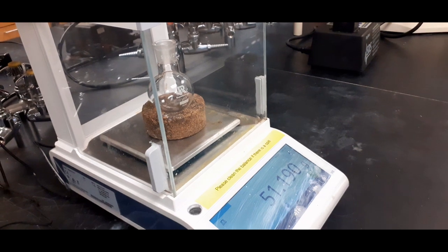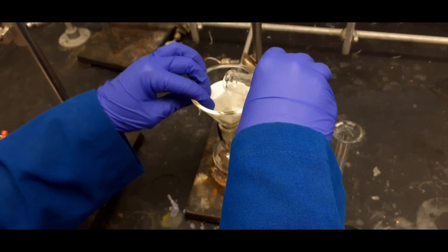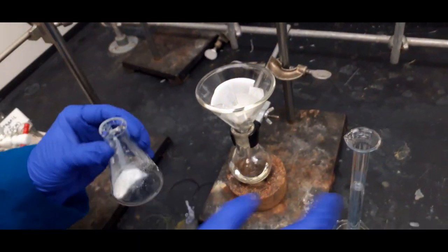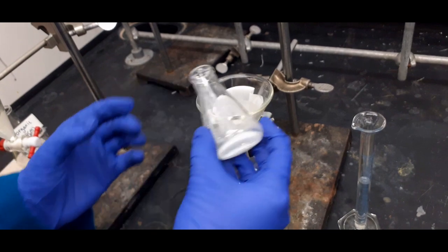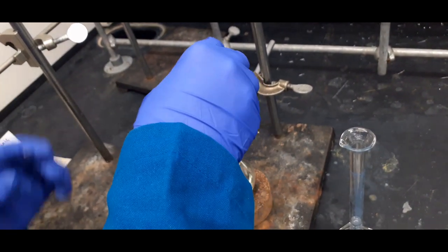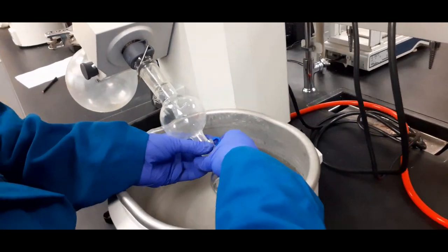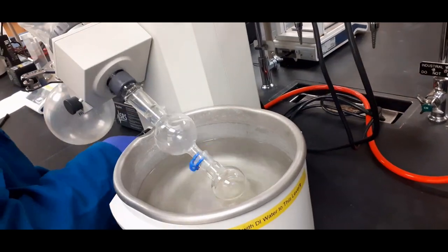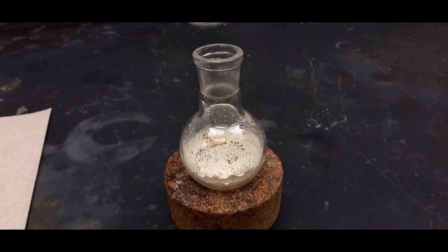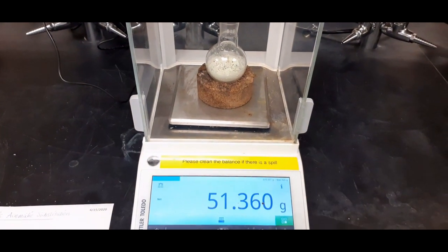Note the weight of the clean round bottom flask. Using a fluted filter paper, we filter out the magnesium sulfate. From the filtrate, the solvent is removed using a rotary evaporator. Note the weight of the dried crude product in the flask.